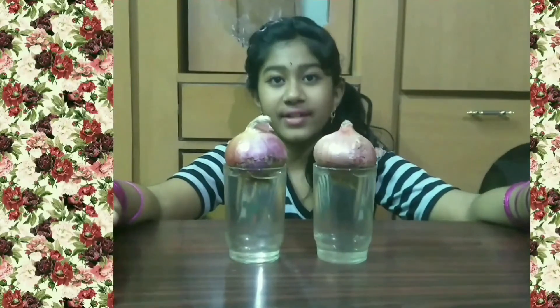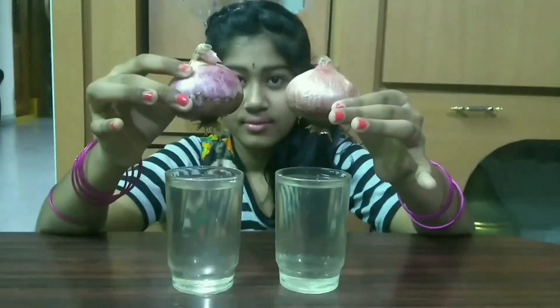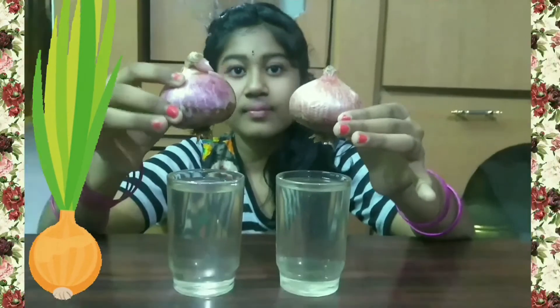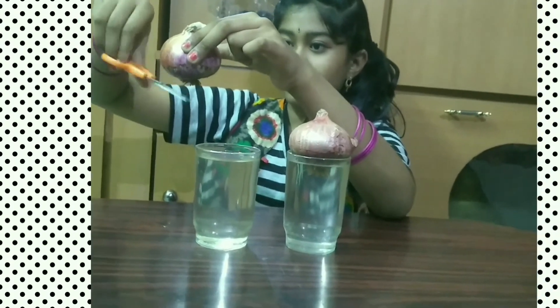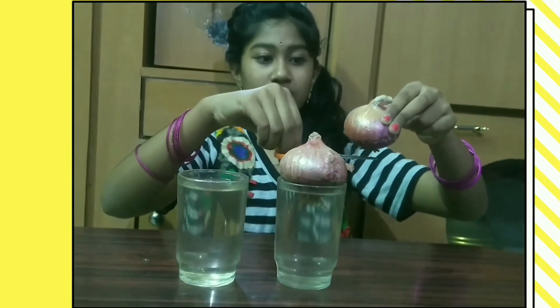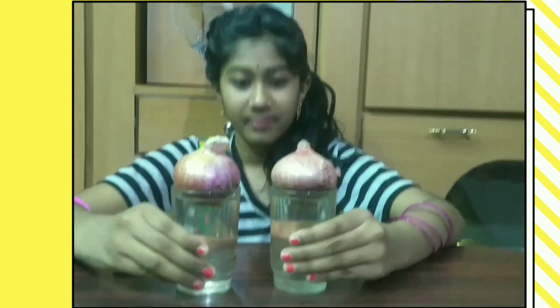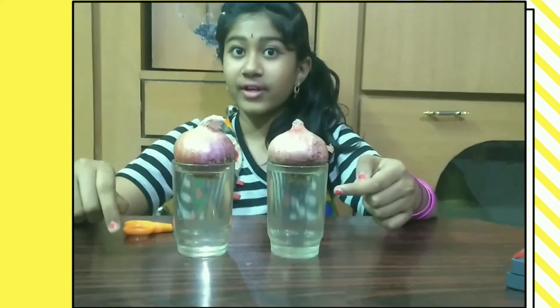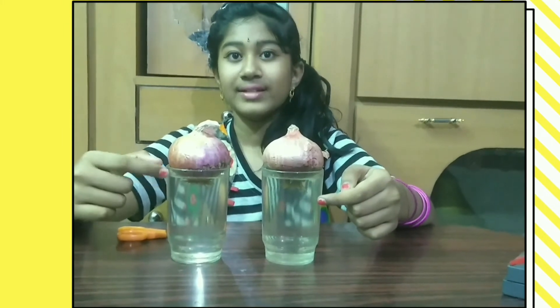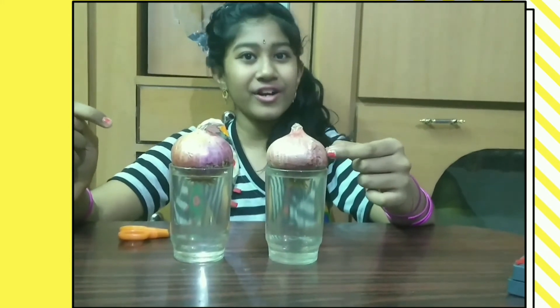We have completed 5 days after we started the experiment. Let's observe the changes. There are a few changes. Now I am cutting the tips of the roots of this onion. I have not cut the roots of the onion in jar 2, but I have cut the roots of the onion in jar 1. According to the experiment, these roots should not grow. Let's see if they will grow or not.